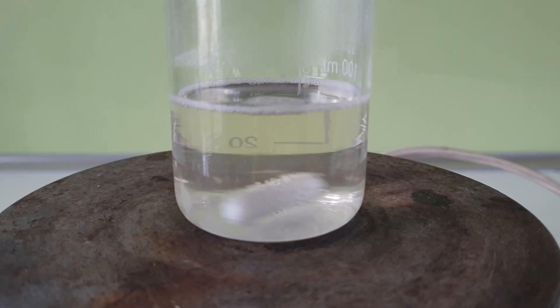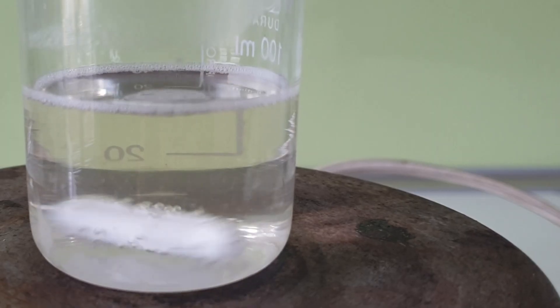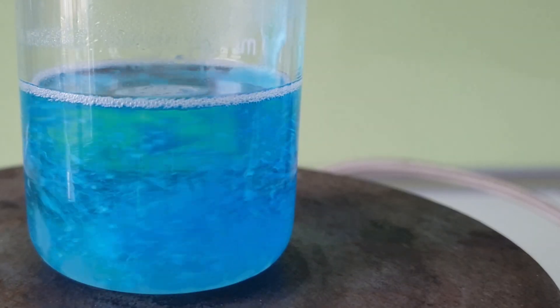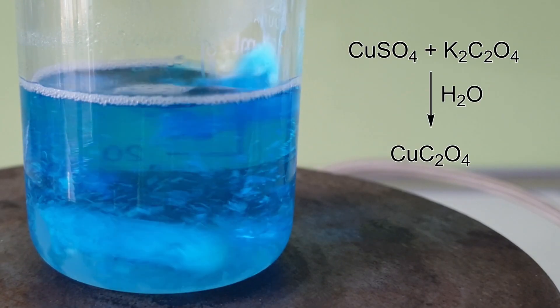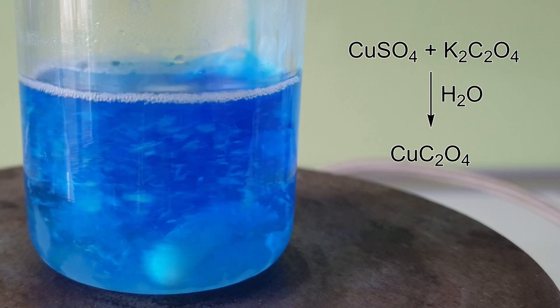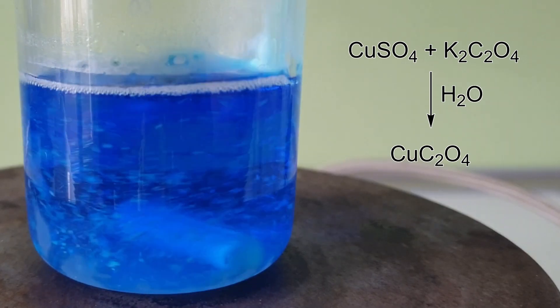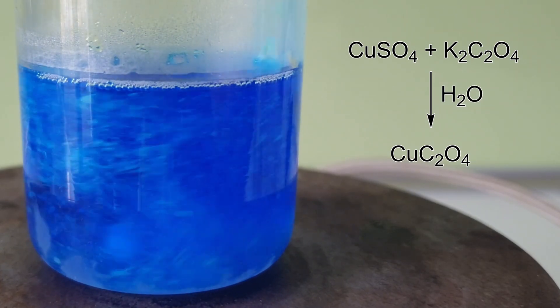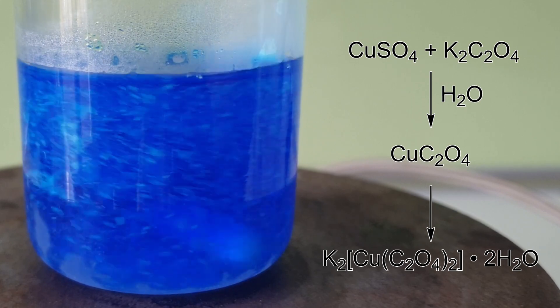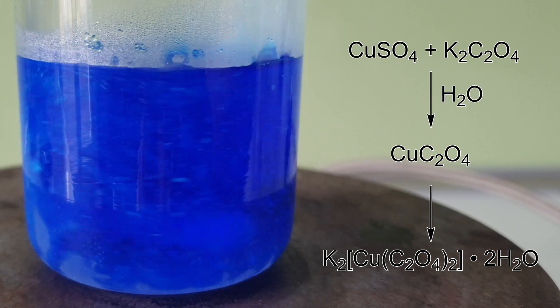To start the complexation reaction, I add the copper sulfate solution slowly to the oxalate solution. Initially copper oxalate precipitates out as a light blue solid, but this quickly dissolves in the excess of oxalate ions to form the bisoxalato cuprate anion.